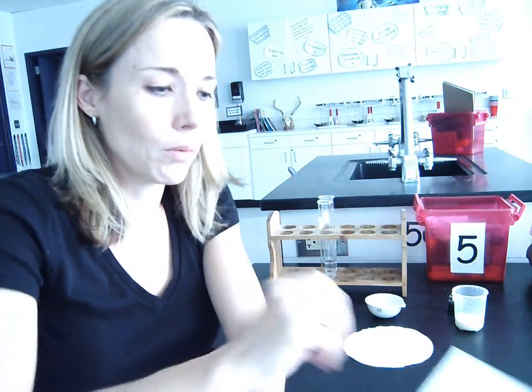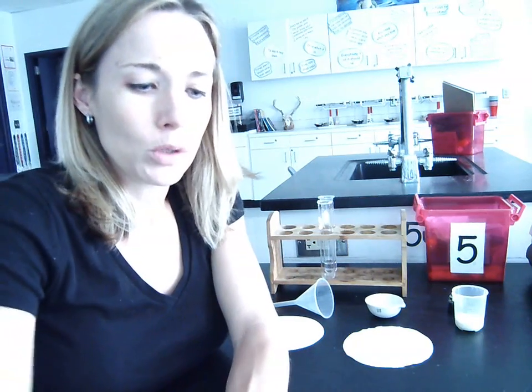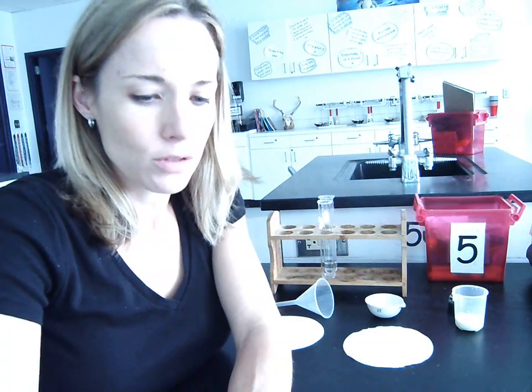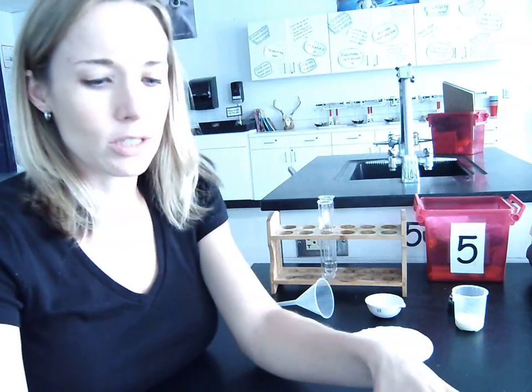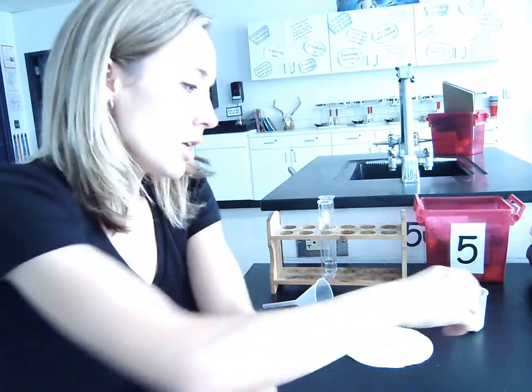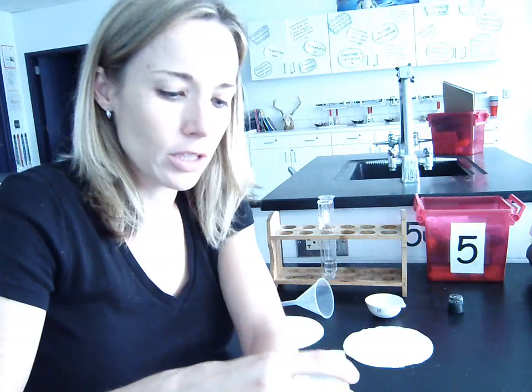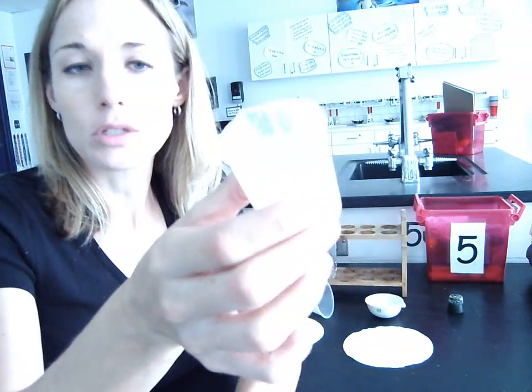That's the beginning of 5.6. I'm going to go back now to 5.4. 5.4 is called the separation of a mixture of solids. And if you read through it, it's just a half a page on page 103. The difference between 5.4 and 5.3 is that in 5.4, we're going to use a mixture of solids where one of the materials dissolves in water and the other one does not.